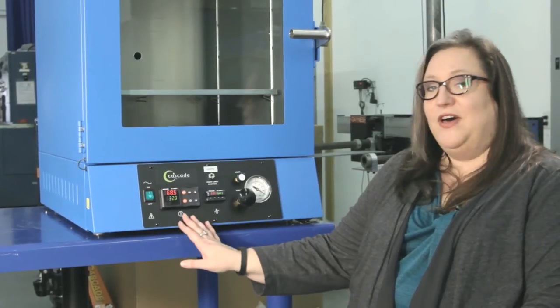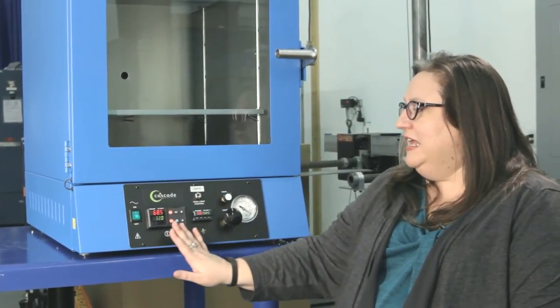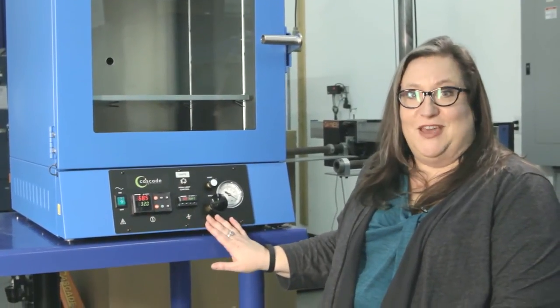Hello, it's Katherine from Cascade Botanical. You might know me from Instagram as Cascade Cat. I'm here to talk about the basic operation of the Cascade Botanical TVO5 or TVO2 vacuum oven. We've already installed the oven, we have the bottom shelf installed, and now we're ready to use the oven.